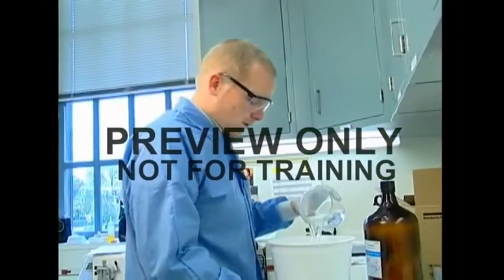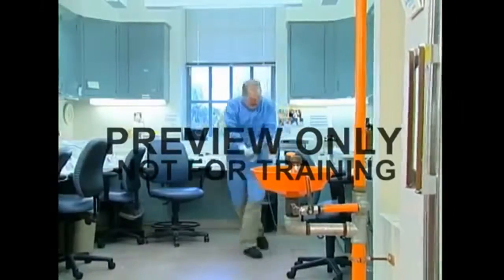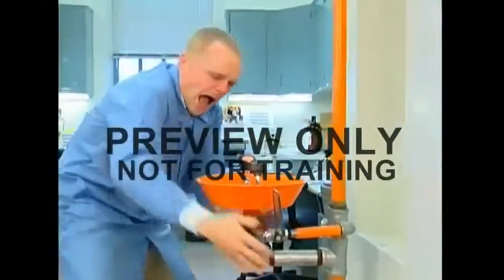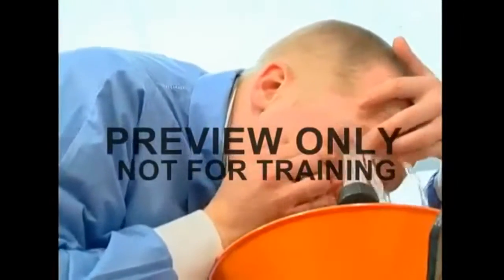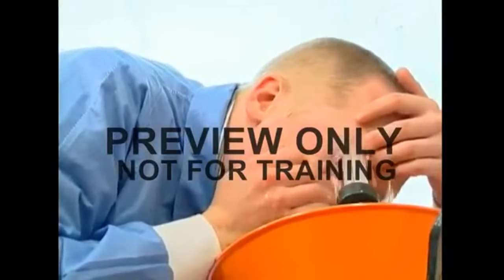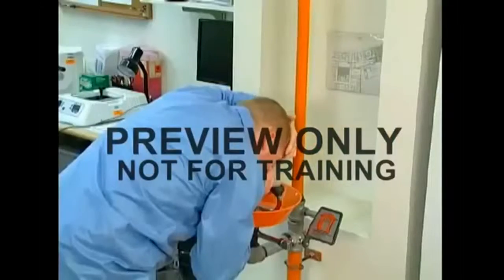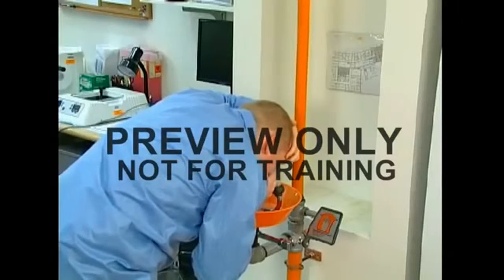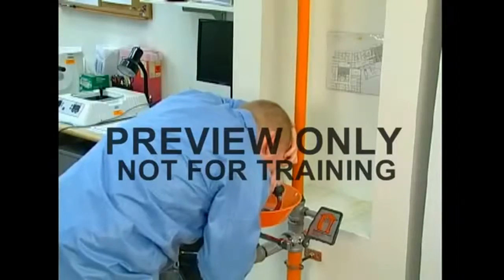If a chemical splashes into your eyes, an eye wash is what you should use. As we've said, it should provide a gentle, continuous stream of aerated water. You must get to the eye wash as quickly as possible. Hold the affected eye open with your fingers to get a complete rinse, both under and behind the eyelid. If only one eye was splashed, do not allow the water to transfer the contamination to the other eye.